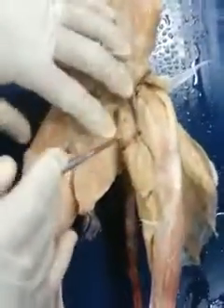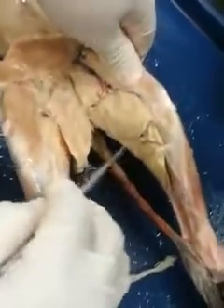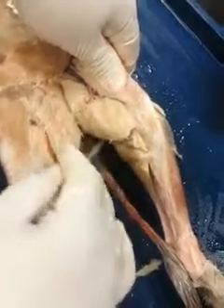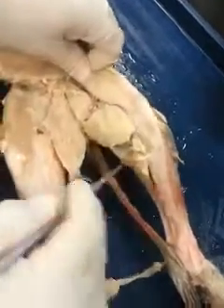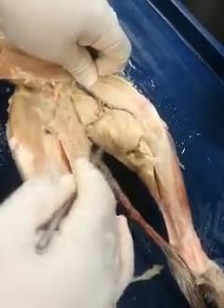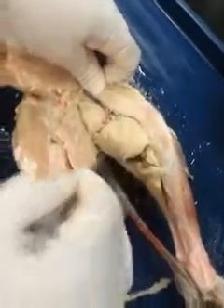If we go to the medial aspect of the thigh, you're going to see the first 2 muscles here. They actually belong to the hamstring muscles of the posterior thigh, so we're not going to name them yet. Actually, just for you guys to know them, here's the semitendinosus, and this one is the semimembranosus. Again, part of the hamstring group, the dorsal.